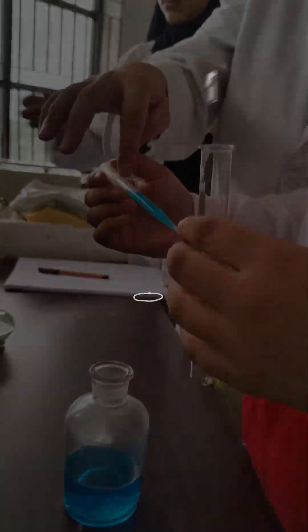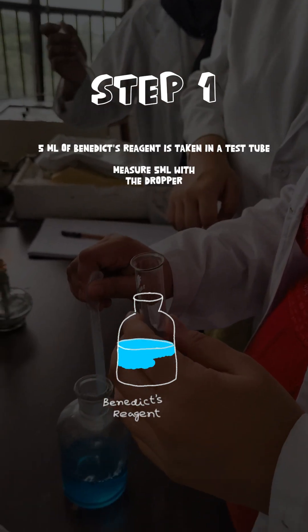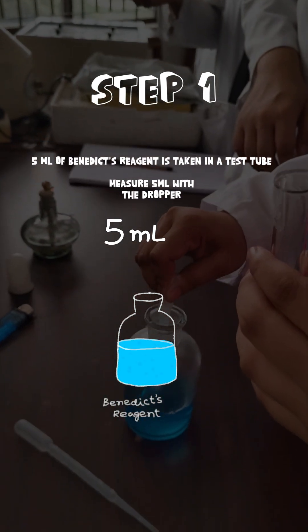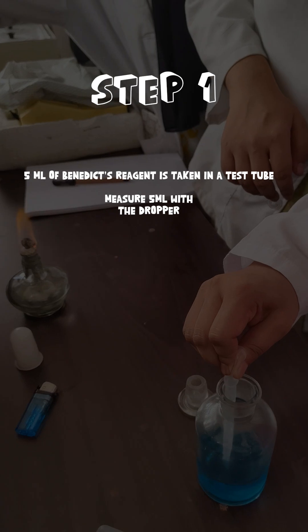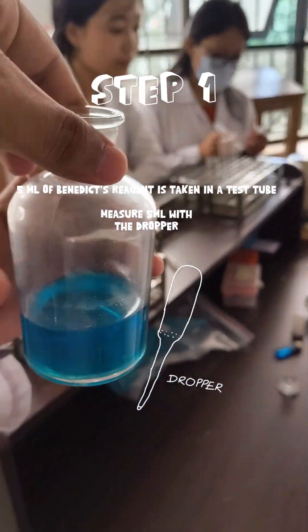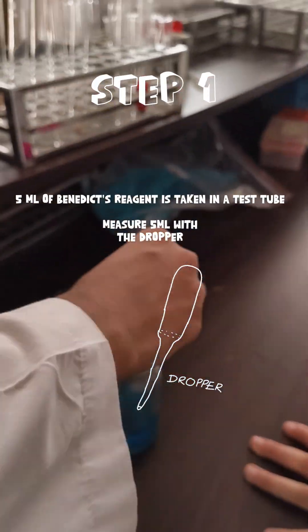Hey everyone, let's see the steps for Benedict's test. Step 1: let's take 5 millilitre of Benedict's reagent in a test tube. We'll use a dropper to measure exactly 5 millilitre.